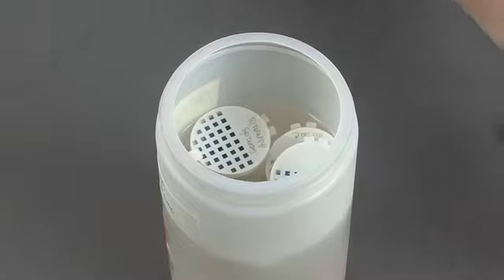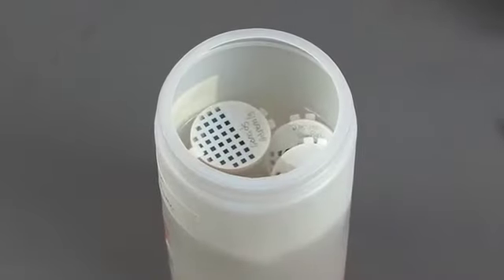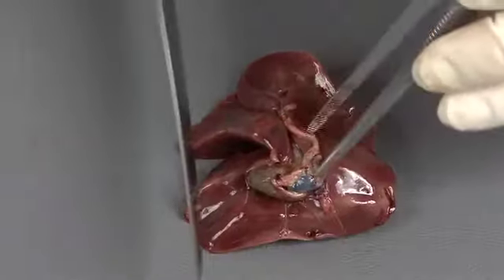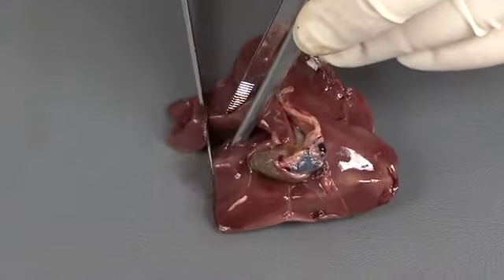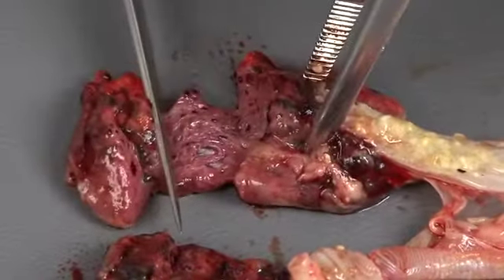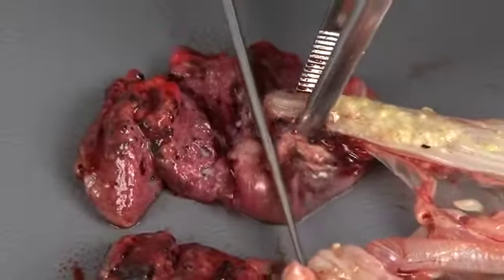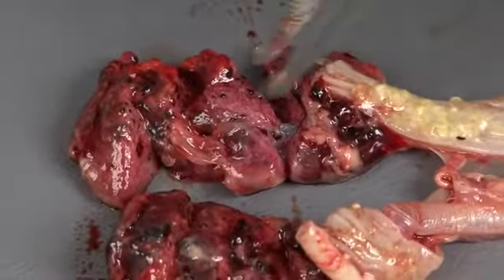During the detailed organ exam, you will also collect samples for histopathology. It's important to collect representative samples from any lesions observed and to include a piece of surrounding normal-appearing tissue. If no lesions are detected on the organ, collect 1 or 2 representative sections of the organ for microscopic evaluation.